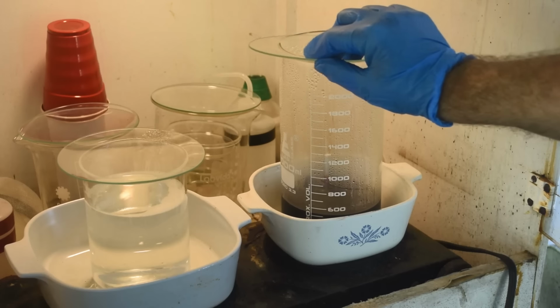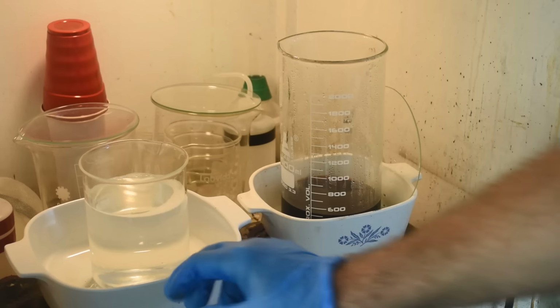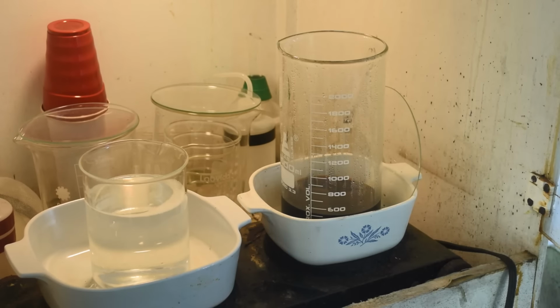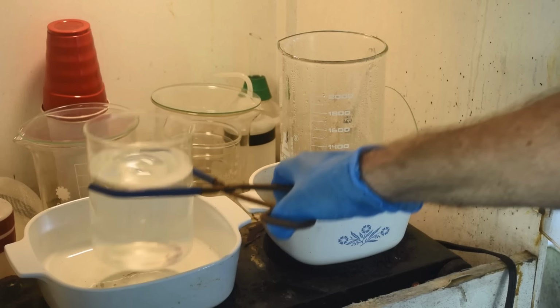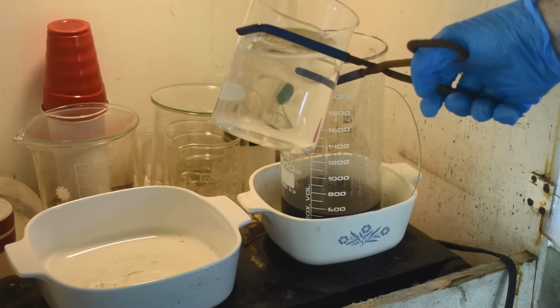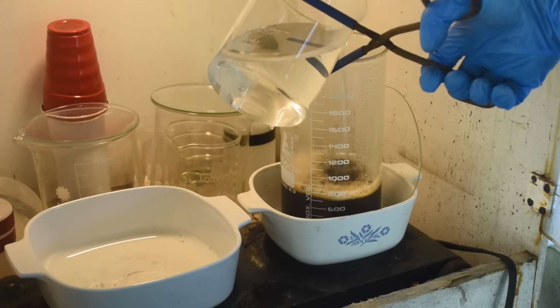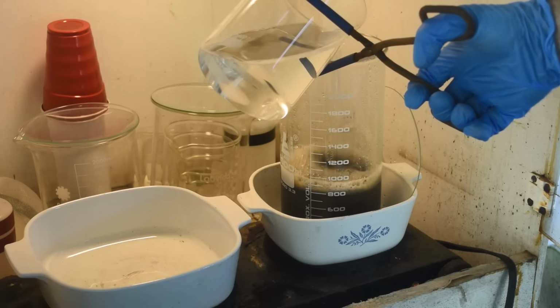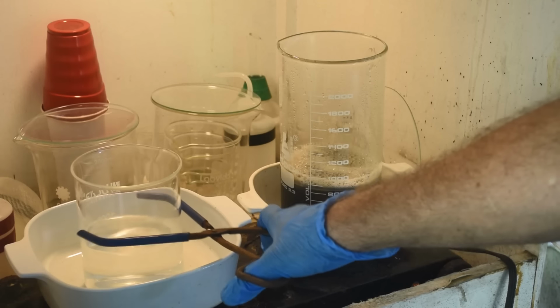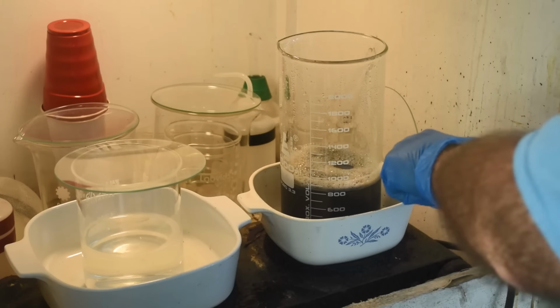Okay, so what I'm proposing to do here, put half of this liquid in here, roughly half. And then boil this liquid for a while. Let's see, where are we here? Oh, notice the color change. It is not red anymore. It's turned gray, which I'm taking as a good sign.